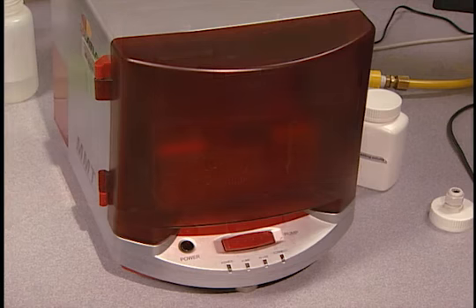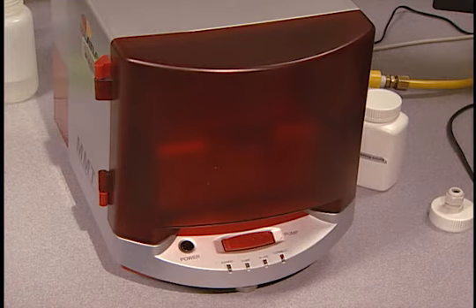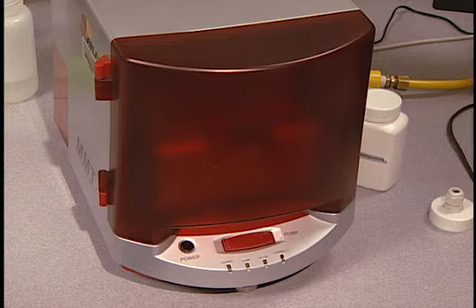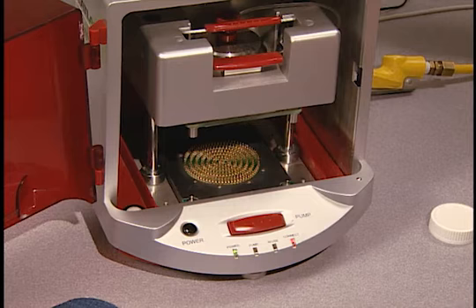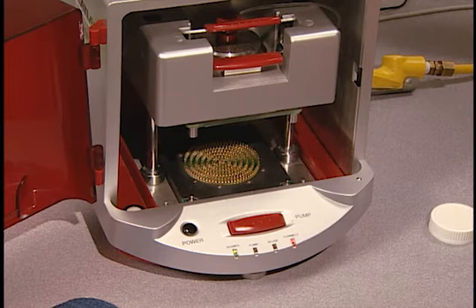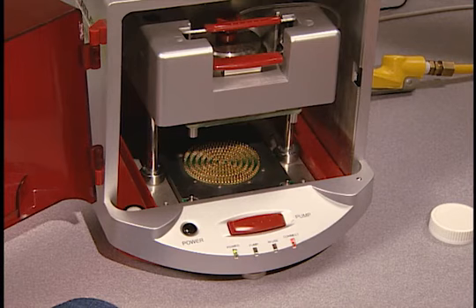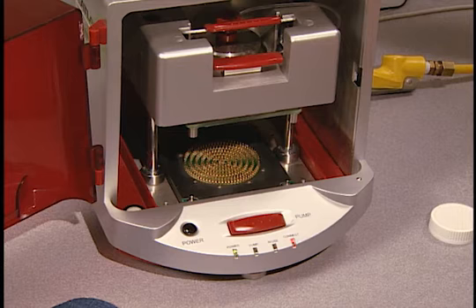The instrument software automatically stops the test after 120 seconds and calculates the test's units of measurement. Test Method 195's units of measurement for the top and bottom surfaces, the face and back of the fabric, are wetting time, absorption rate, maximum wetted radius, and spreading speed.